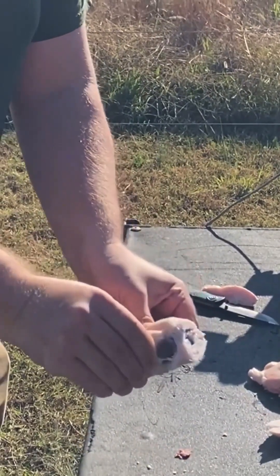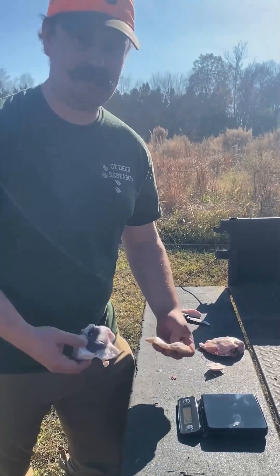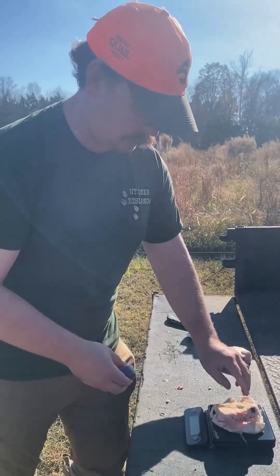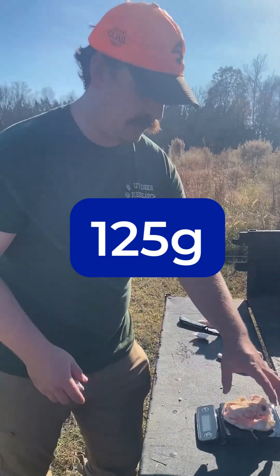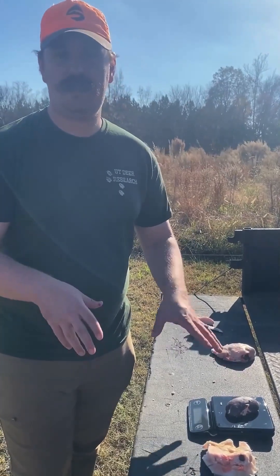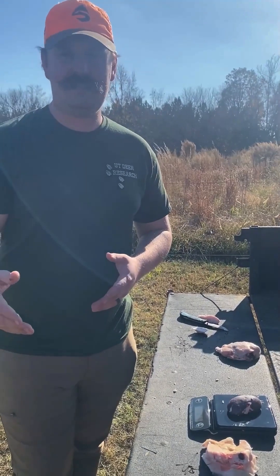Then you simply peel all this fat away, and using a small basic digital kitchen scale, we're just going to lay all the fat on there. So we have the weight of the fat, which is 125 grams on this one, and then we're going to weigh the kidney itself, which weighs about 65 grams. So on this one, the kidney fat index would be 125 divided by 65.